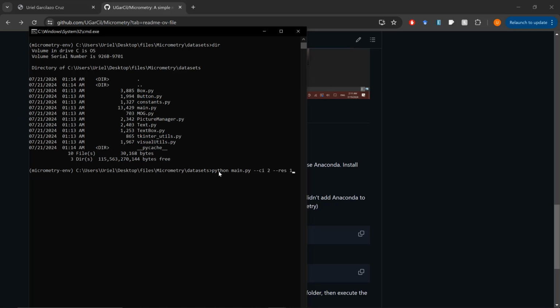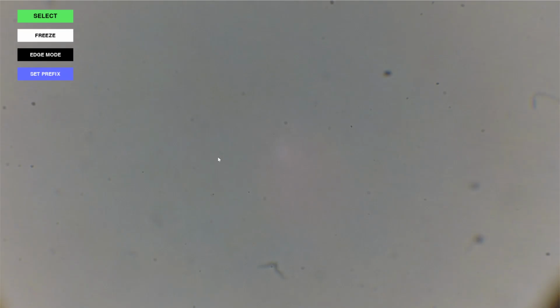So at this point, I'm ready to connect my webcam with my microscope. After pressing enter and waiting for a little bit, now the camera will open on my screen. So here I'm going to zoom into the sample that I have placed just from a drop of water that I took from a pond.